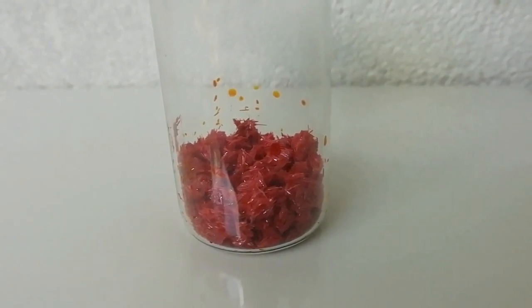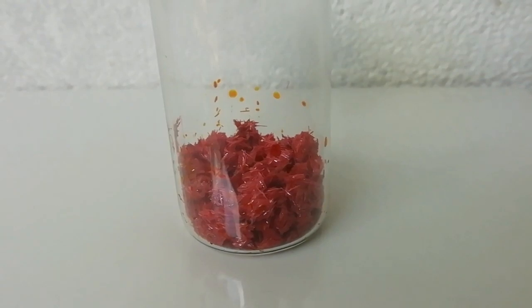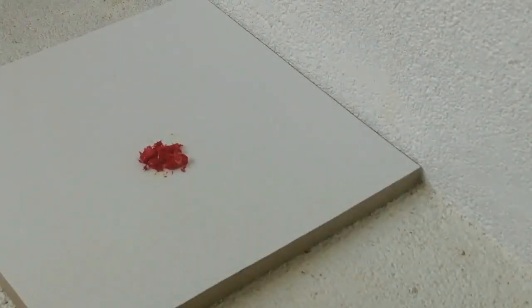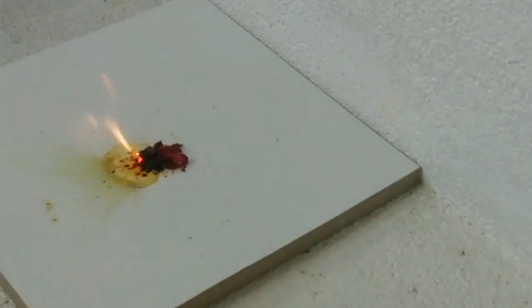To test the product, I took 0.25 grams of chromium-6 oxide and put a few drops of isopropyl alcohol on it. Quickly, it oxidized the alcohol and ignited the alcohol.